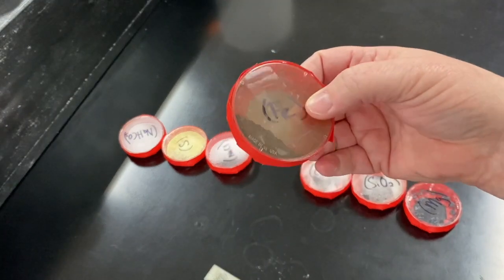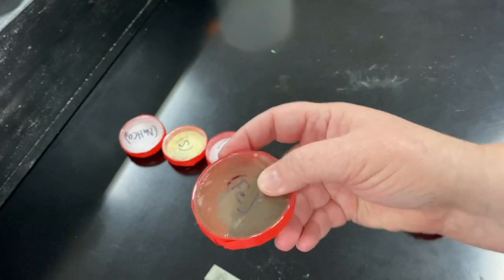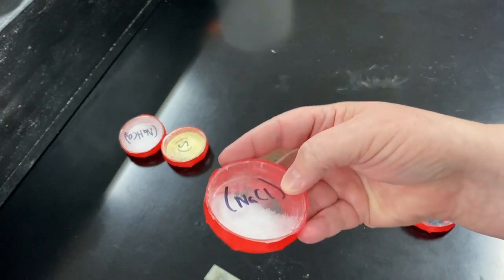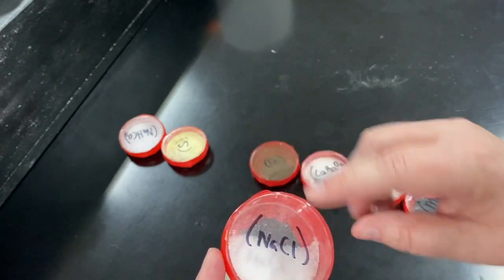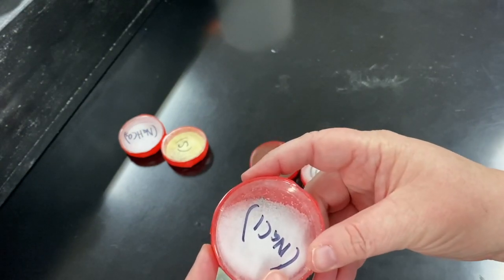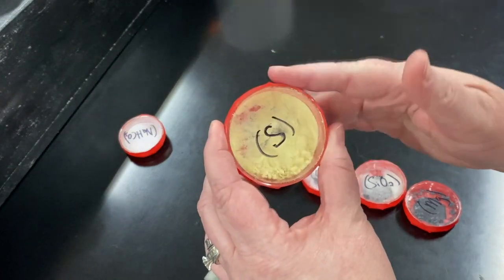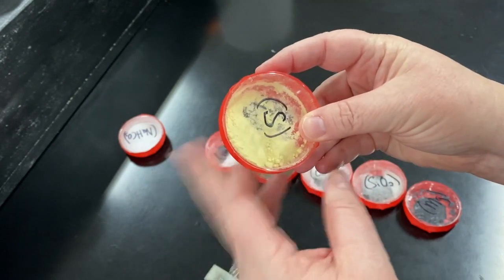This is iron. Notice it's got kind of a dark brown color to it — this is elemental iron. This is sodium chloride, also known as table salt. You can see it's crystalline in structure, almost like a bunch of little tiny rocks in there. It's white and also solid. Here is elemental sulfur. Notice that it is yellow, also a solid, but it's got more of a powdery texture to it.